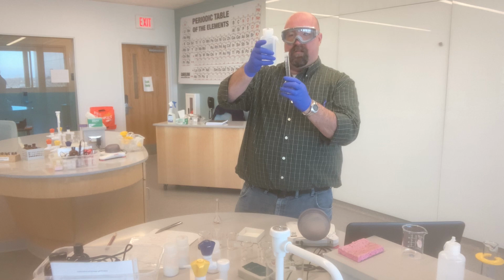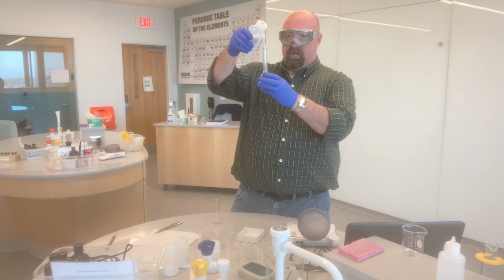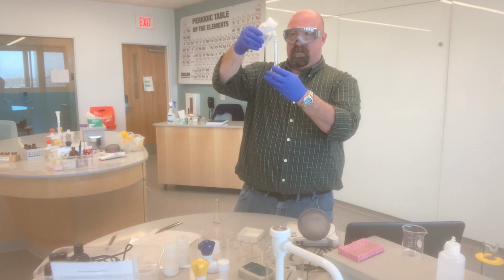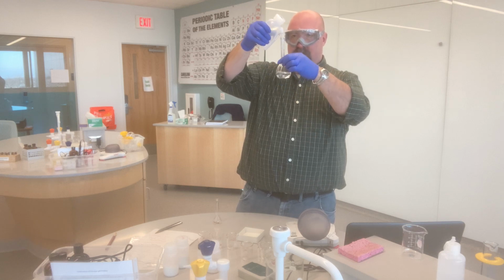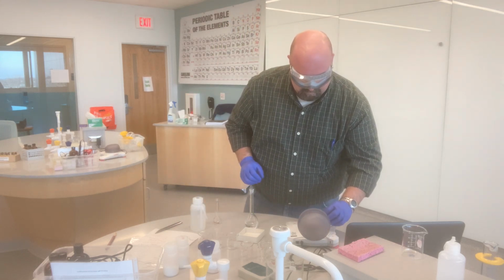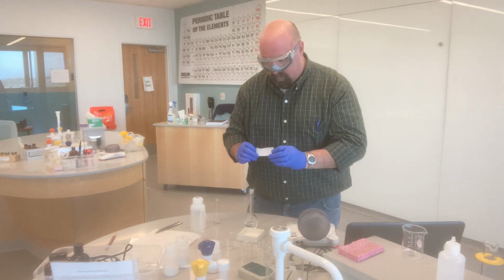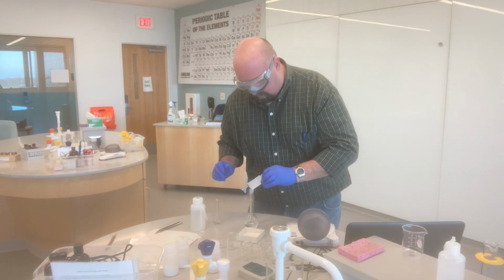And so like I said, I'm just going to add in a little bit of water now into the volumetric flask. This is not the most efficient way to do it, by the way, through this water bottle, but I'm stubborn and that's how I've started, so that's what I'm going to keep doing. So I've got a little bit of water in there now. Now I'm going to take my solid. Remember when we looked at Module 0 on ways that we use the balances? I've creased my weigh paper nicely so that I can now just dump my solid in there.